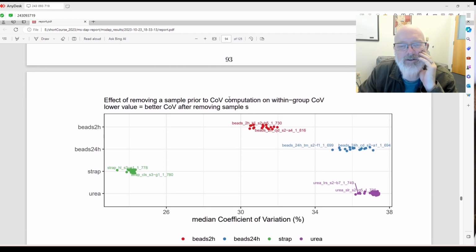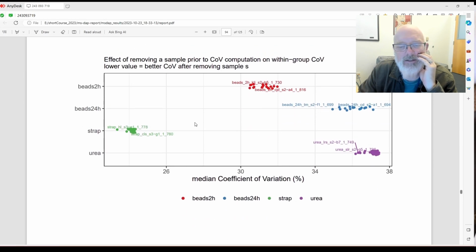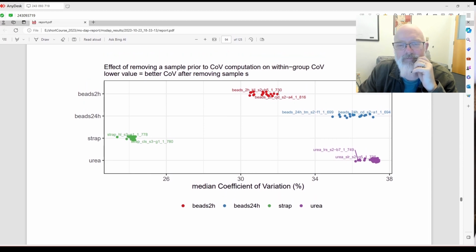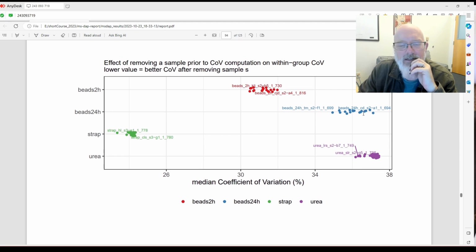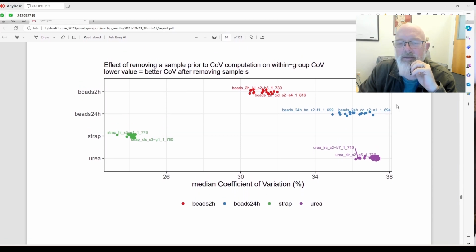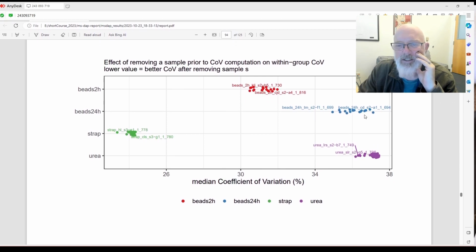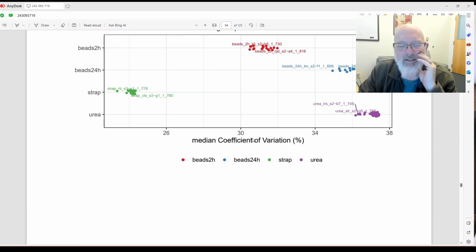Effect of removing a sample prior to coefficient of variance computation on within group COV. Okay. All right. Median coefficient of variation. You could see the S-traps were way better than the beads 2 hours. And the beads 24 hours, and urea had the highest coefficient of variation. But still, we had like a 20% with the S-trap. And the beads I think would be less, but when we did the protein precipitation on the beads, that was probably pretty variable. And then the urea had a lot of variation.